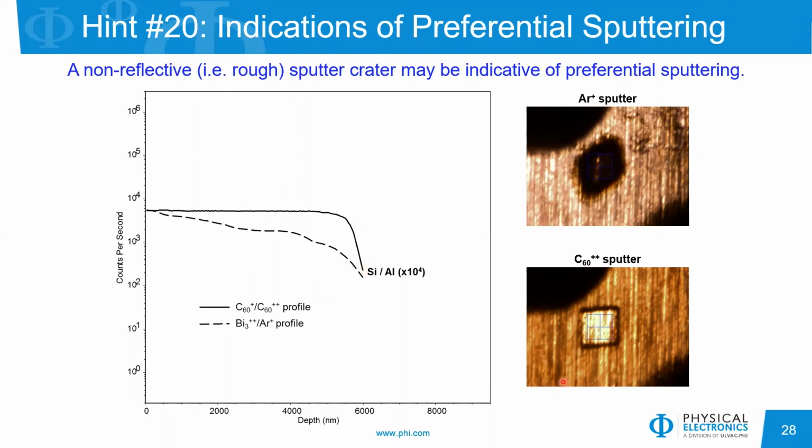So we switched over to C60 sputtering, and I used the 40 keV C60 double plus ion for sputtering. In this case, we see a nice reflective sputter crater, which indicates that the crater bottom is quite uniform and has not roughened as a function of depth. And if we go back and look at the data, we see as a function of depth that the silicon to aluminum ratio is quite uniform.